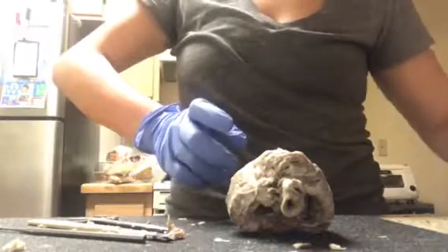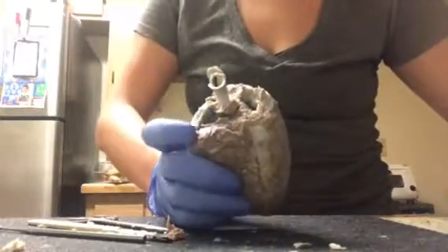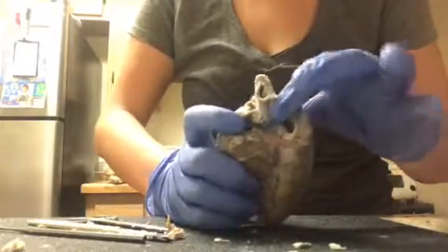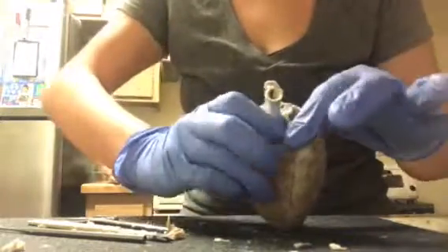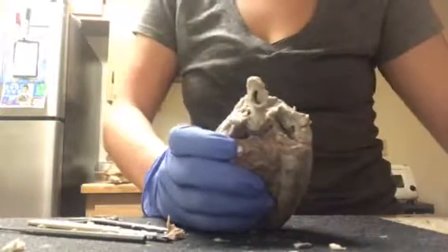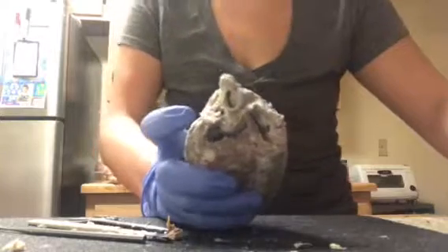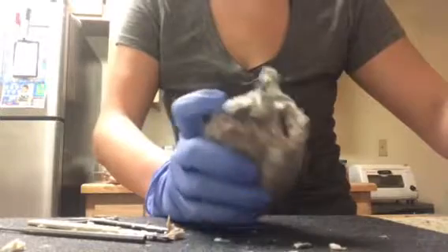So what I'm going to show first, we can see that this will be the aorta. What I had to do here was I had to cut along the top and a little bit into the heart to expose it. At first, with all this around it, I didn't realize that it was the aorta, so I did keep going. I think there's a couple parts missing here, so I'm just going to work with what I have.